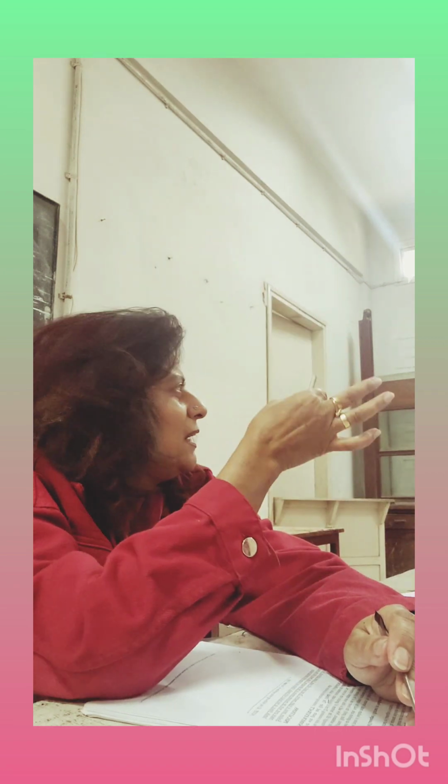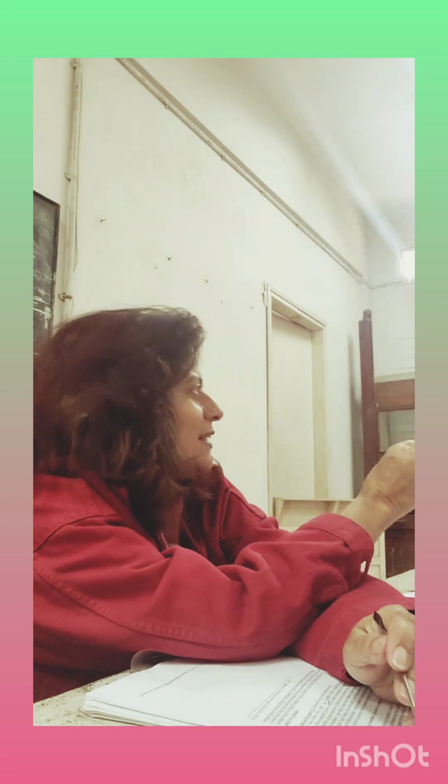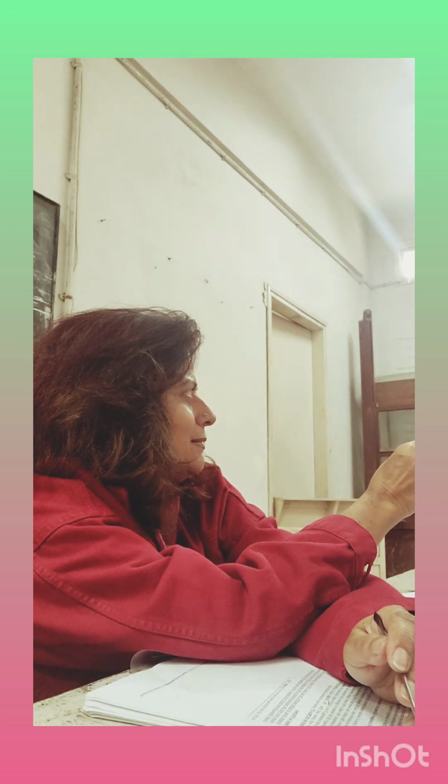It's never washable. Boys, you were almost right, but these four were all wrong. So sure, so wrong. So, this can't be reused. This can't be washed. You cannot rinse it. You cannot wash it. Keep this thing in your mind forever.